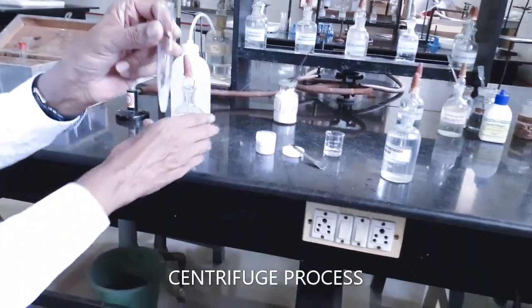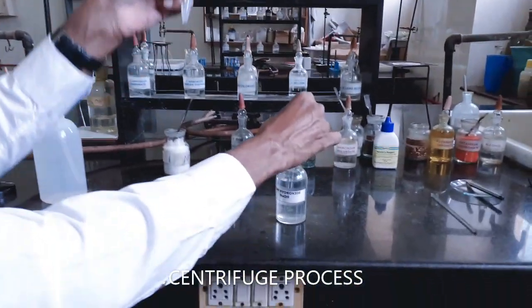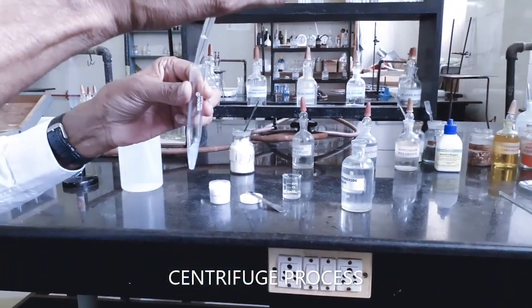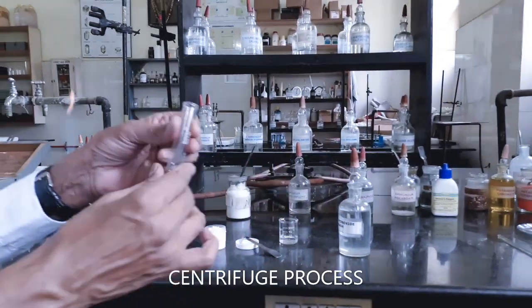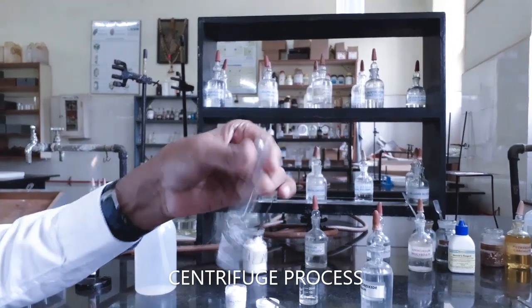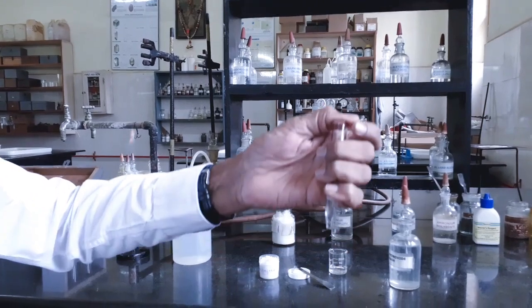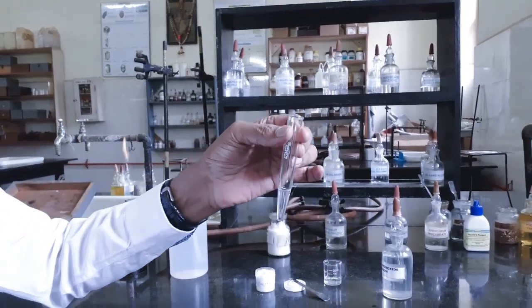For that purpose, I am going to add sodium hydroxide. If this white gelatinous precipitate is aluminum hydroxide, on adding 2-3, maximum 5 drops of sodium hydroxide and on shaking, it should dissolve. You see, it is dissolving. The precipitate is dissolved and a clear solution is formed. So this clear solution is sodium aluminate.